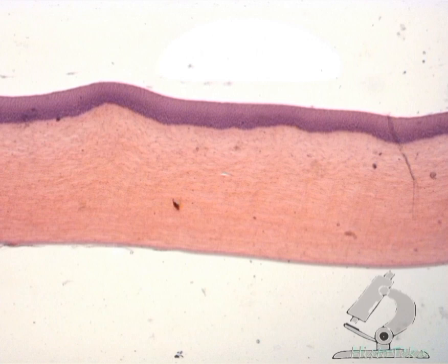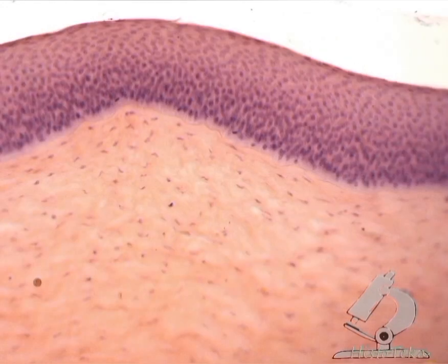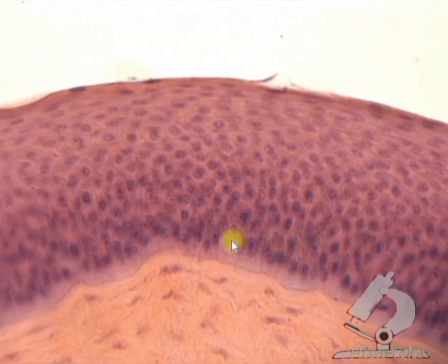The stratified squamous non-keratinized epithelium, like any surface epithelium, is located at the interface of two environments of the body, internal and external. Therefore, it looks like a strip on the outer surface of the organ on the preparation. Stratified epithelium consists of several layers of cells. That means not all cells are adjacent to the basement membrane, but only the cells of the lower basal layer.